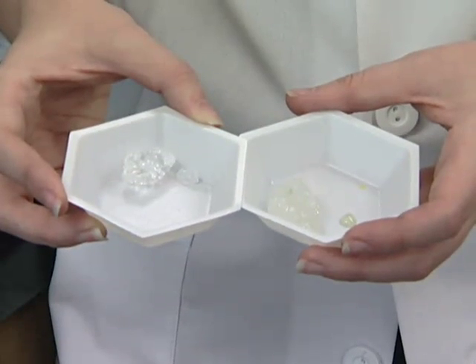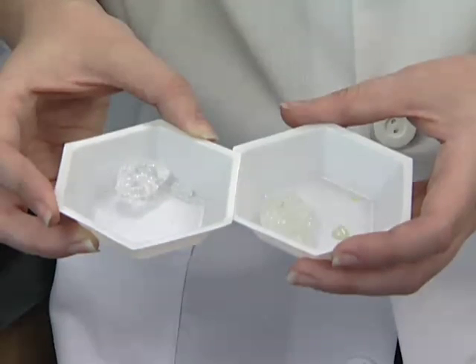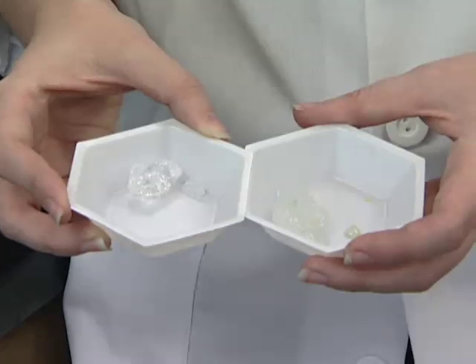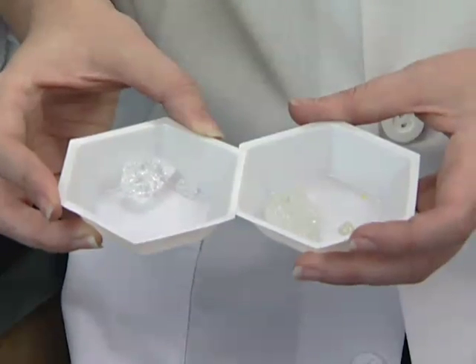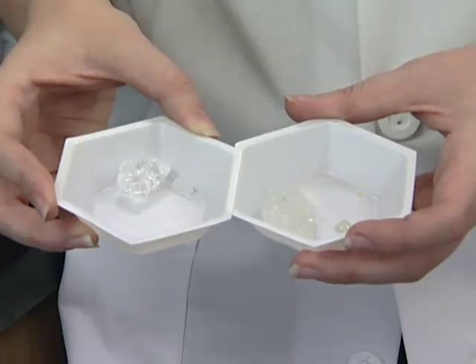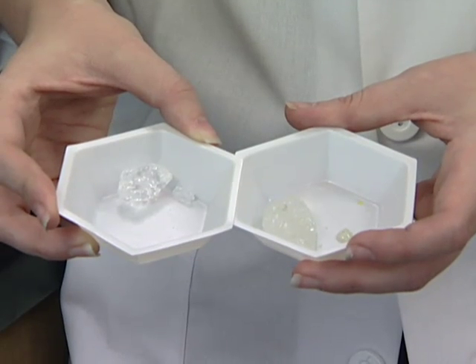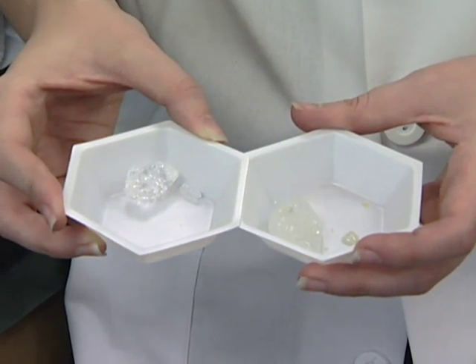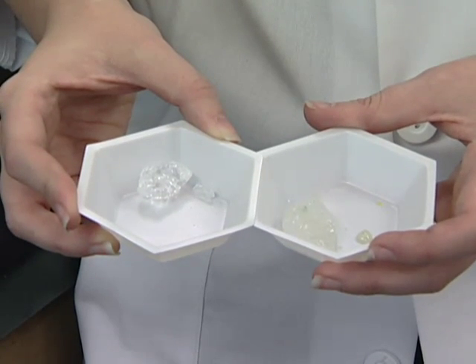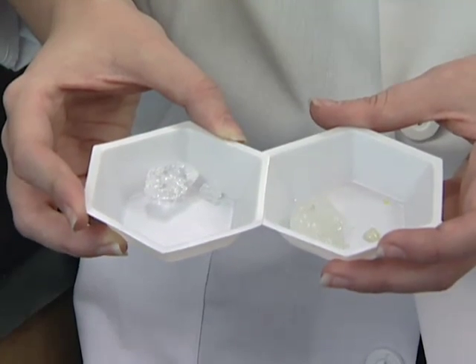One of the most important parts about making a sodium sulfide solution is to have good sodium sulfide. We keep ours on a desiccant to keep out any extraneous water. As you can see, the crystal on your right has a yellowish tint and is actually in some places starting to turn a little green and is cloudy. This indicates a crystal that is well past its prime and has gone bad. On the left is a crystal that is clear and not cloudy at all. This is how you want your sodium sulfide to look.